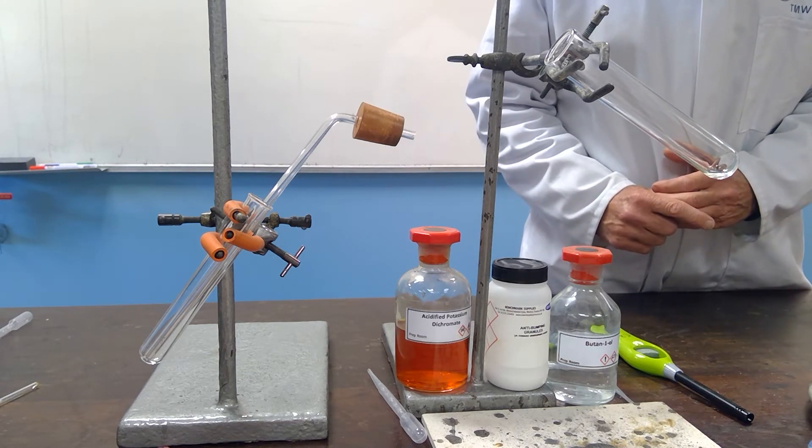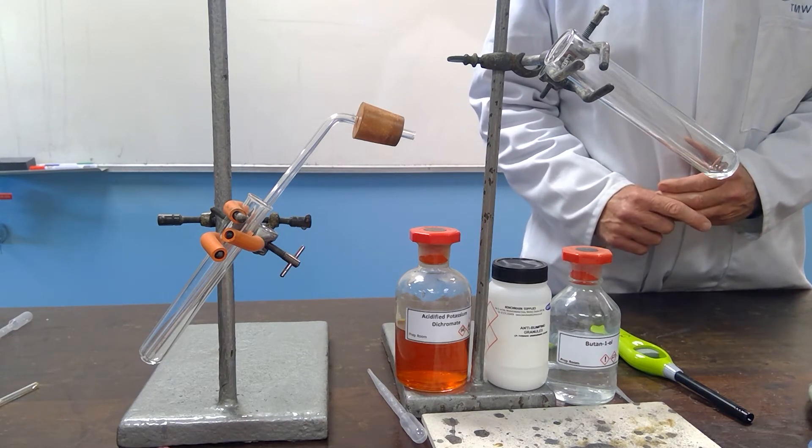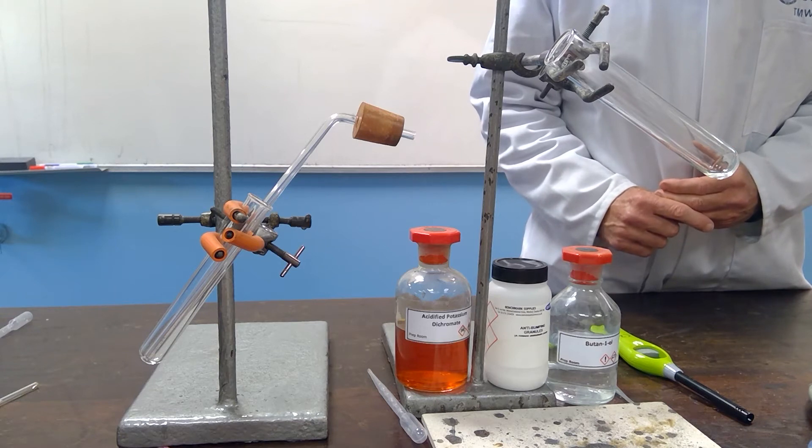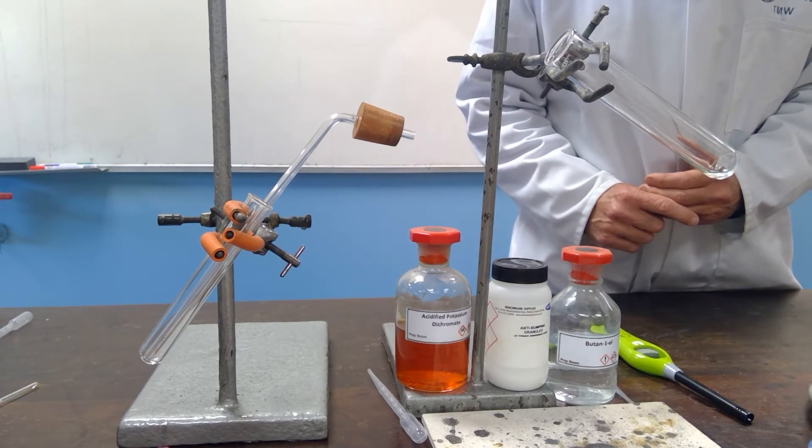Both methods are the same, and although you should use simple distillation to do this, a simpler laboratory distillation which doesn't involve a Liebig condenser is suitable for this method.